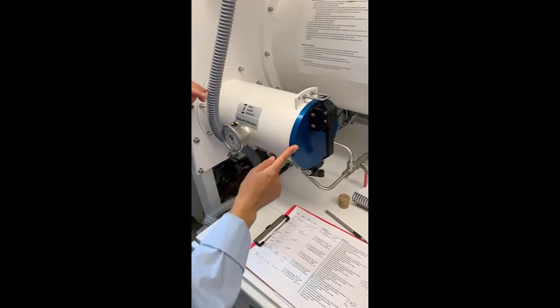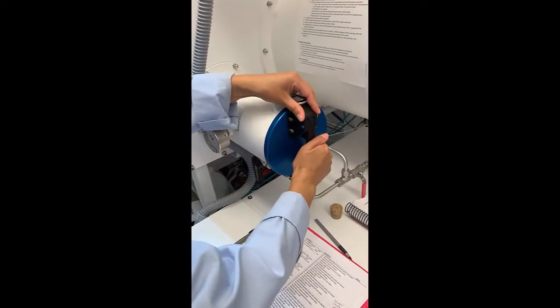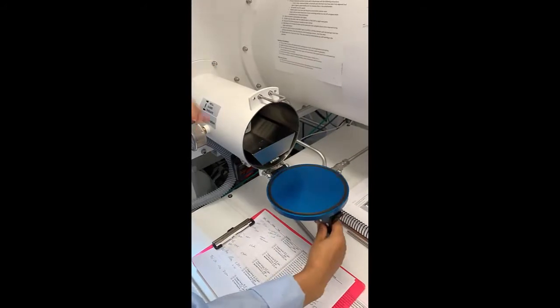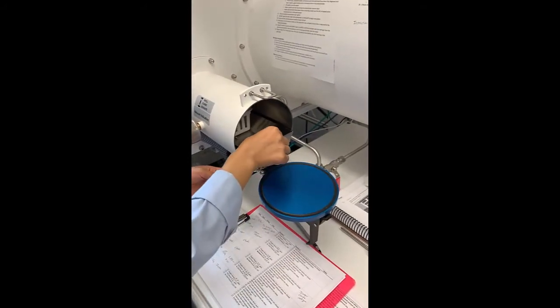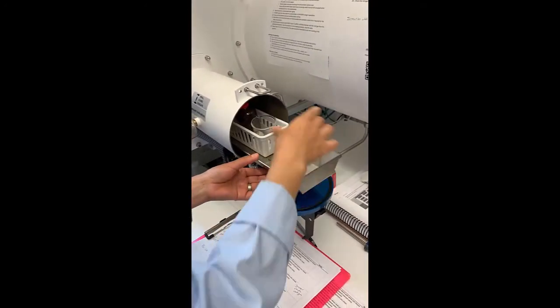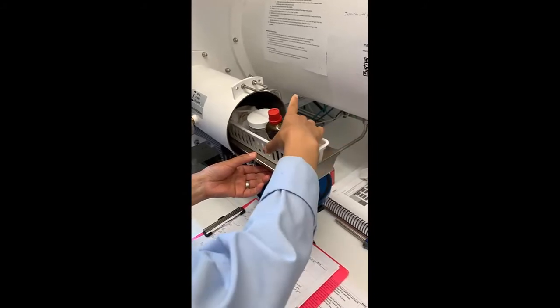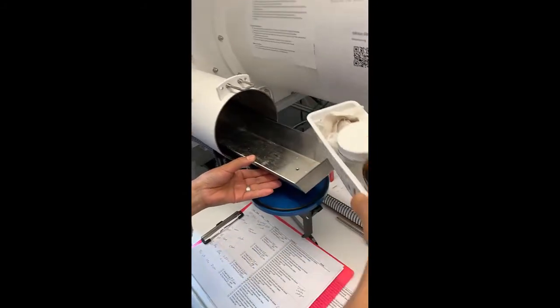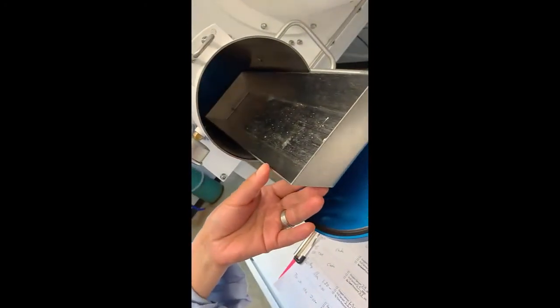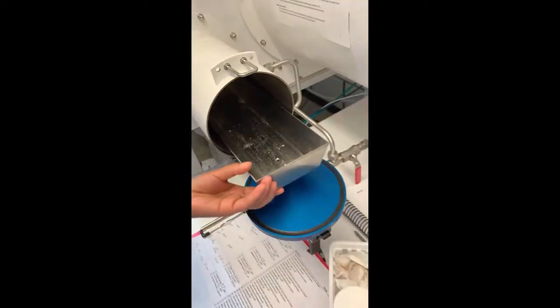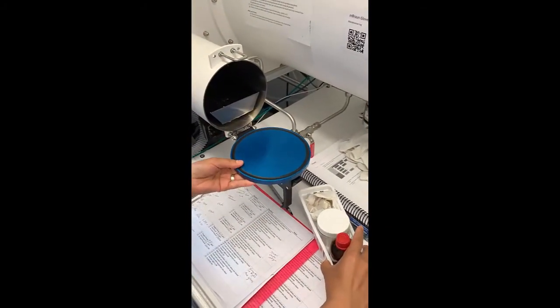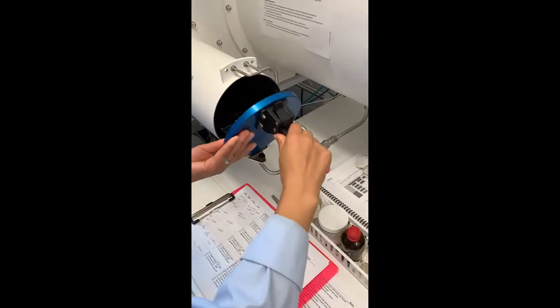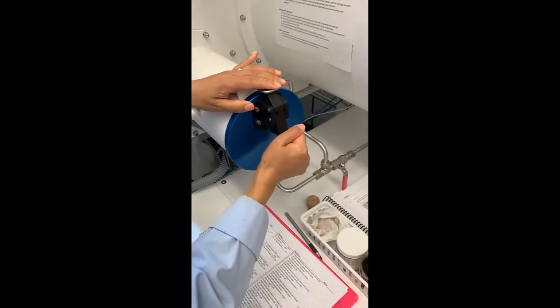So first, to take items out of the glove box, you can just open the door. No need to evacuate or refill. Make sure to remove all items and check inside the antechamber to make sure that it is empty. Close the door to the antechamber and make sure that the black latch is sealed.